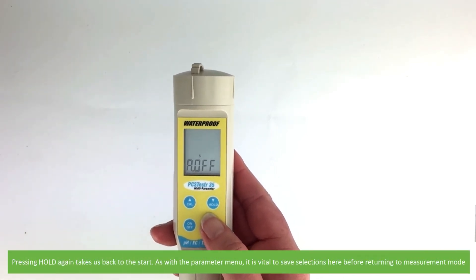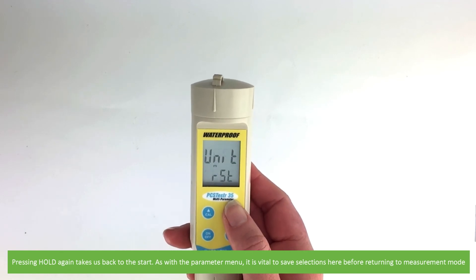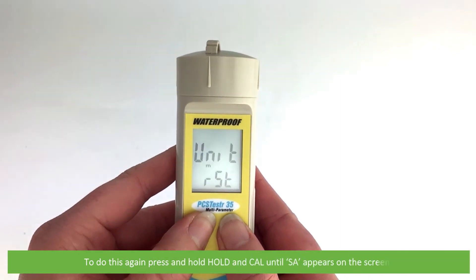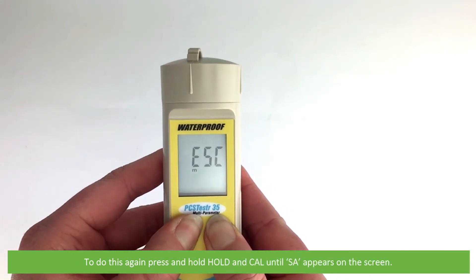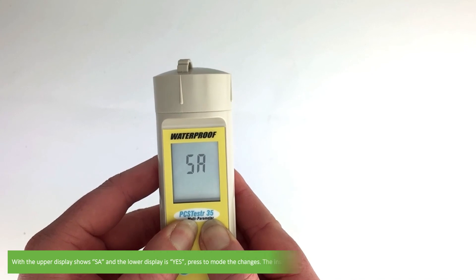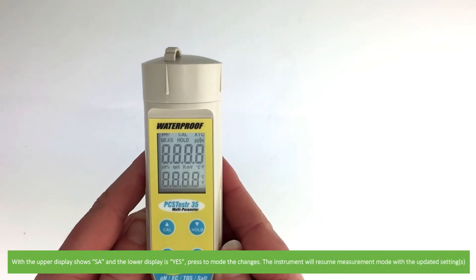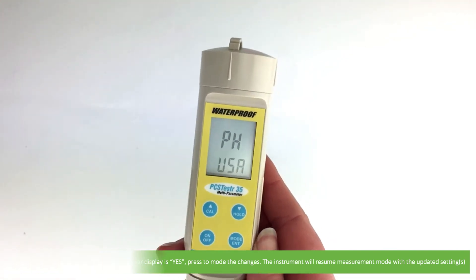Pressing hold again takes us back to the start of the menu. As we did with the parameter menu, it is vital to save selections here before returning to measurement mode. To do this again, press and hold, hold and cal until SA appears on the screen. When the upper display shows SA and the lower display shows yes, press mode to save the changes. The instrument will then resume measurement mode with the updated settings.